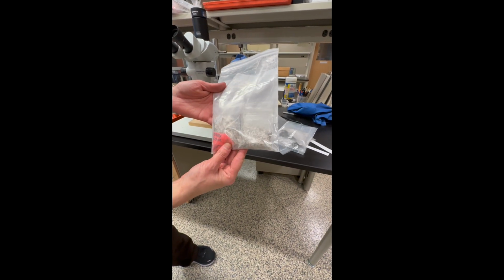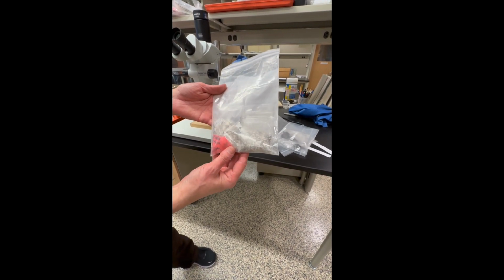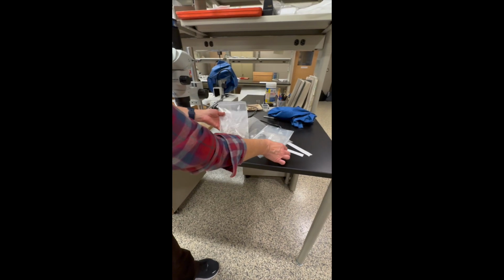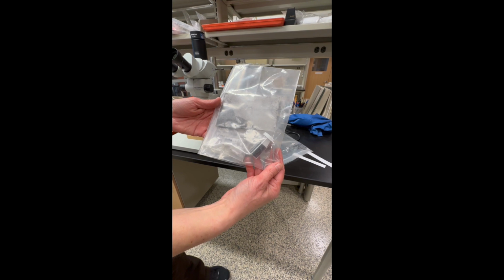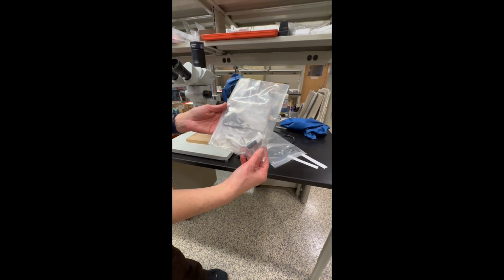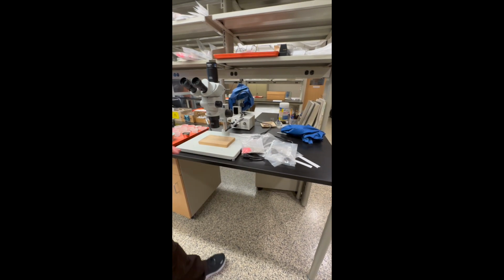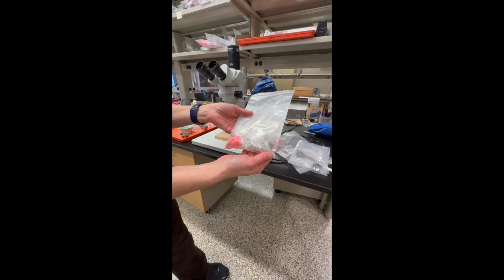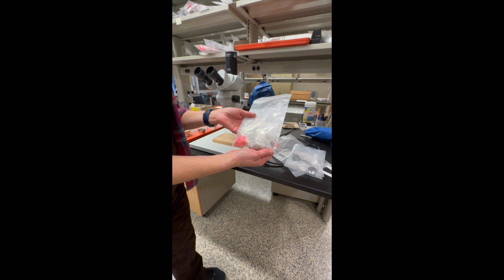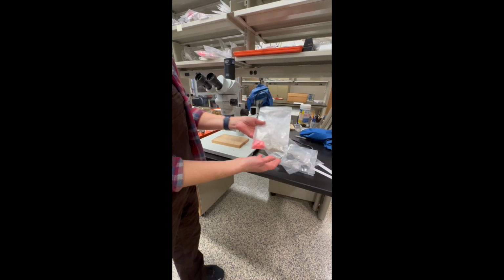This happens to come from a shell-midden site in South Carolina on the coast. And then your light fraction materials is a bunch of carbonized plant remains and other bits of uncarbonized plant stuff. And you'll notice too, lots of little tiny bits of shell and bone and other small artifacts, so the heavy fraction is actually a lot of fun.